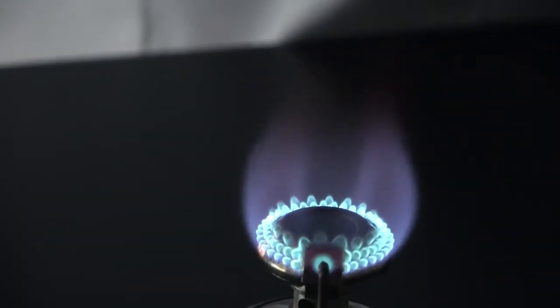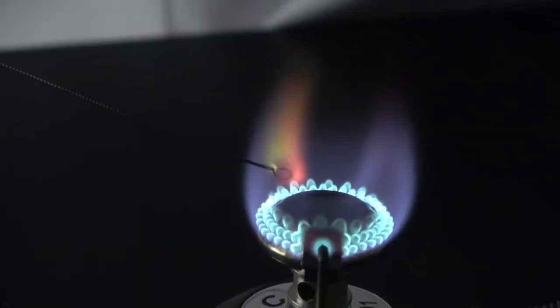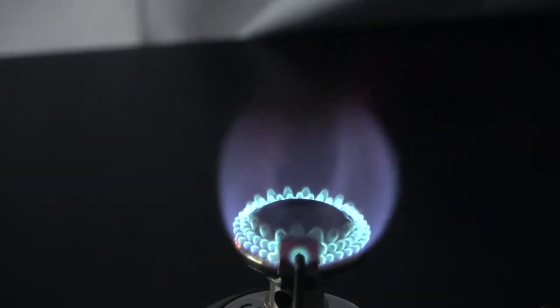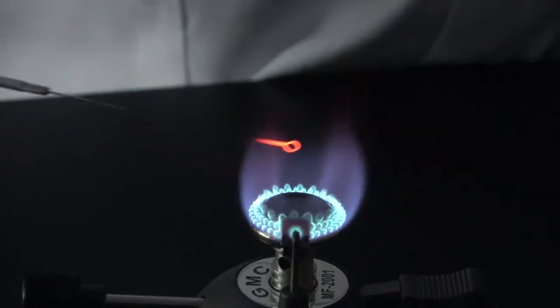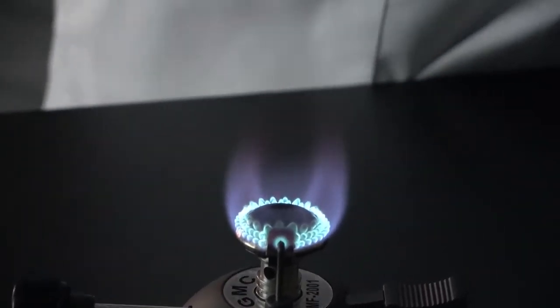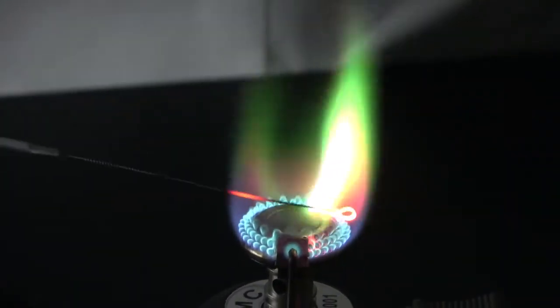Let's do it again. Again. Looks like the wire hasn't been cleaned completely.